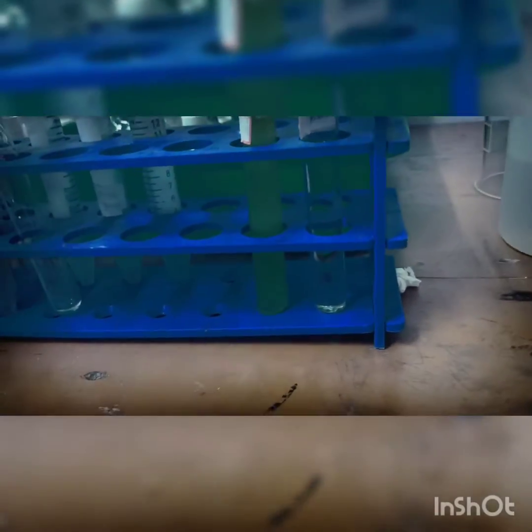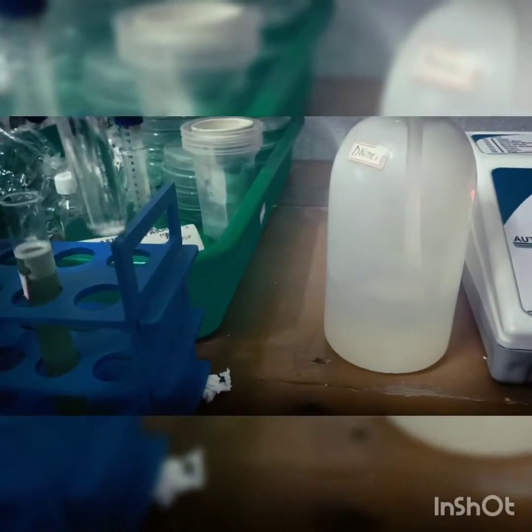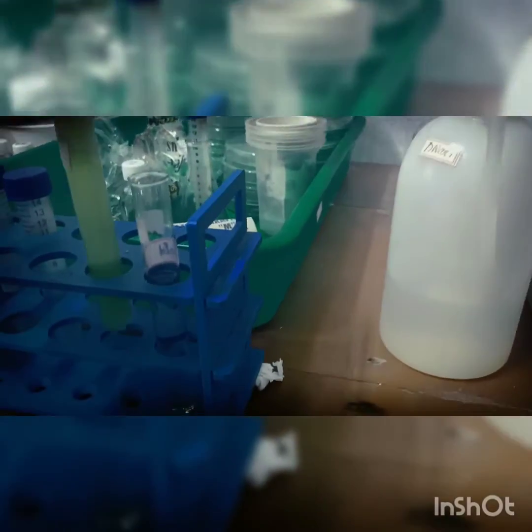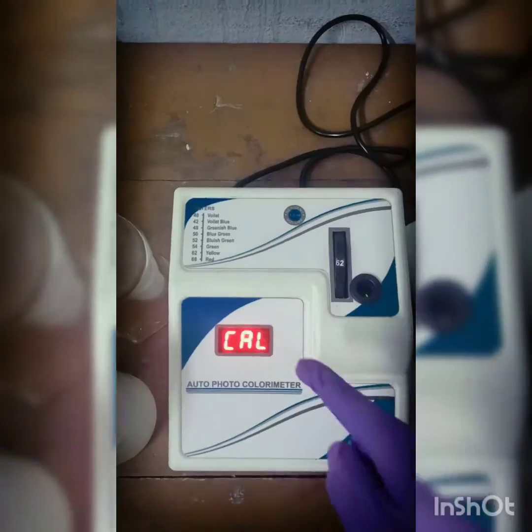Now this is our sample. One sample is a blank. This one is the blank sample which contained ethanol, and the other one which is green in color is containing the chlorophyll. That means the leaf is crushed with the ethanol and is centrifuged to get that supernatant. We will determine the OD of the supernatant.